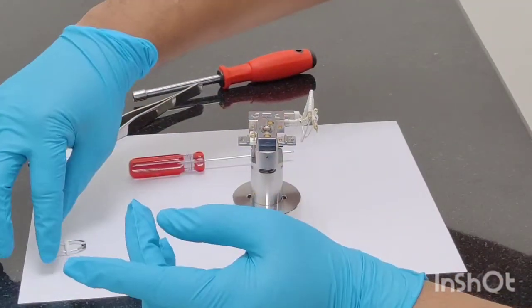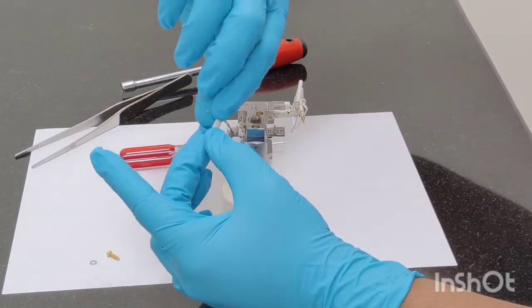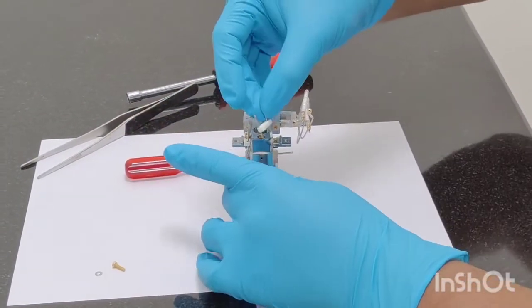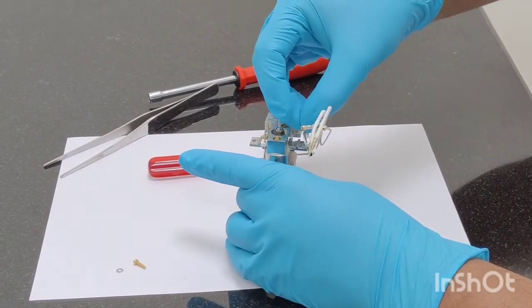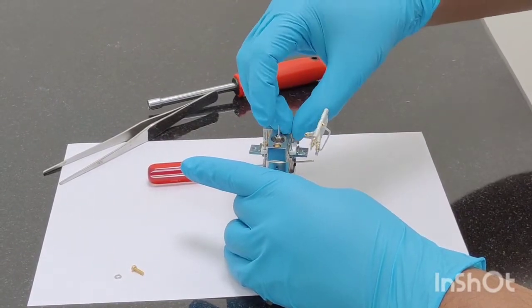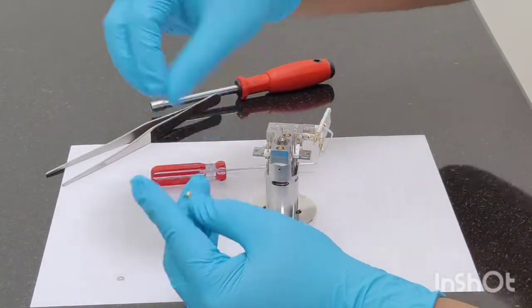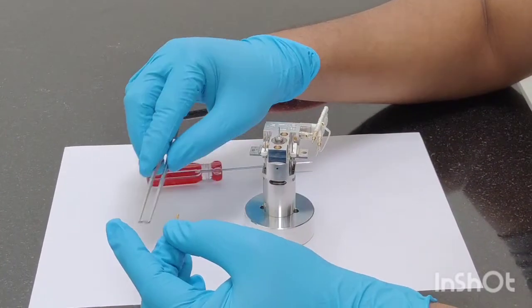Again do not over-tighten anything, all these parts are made up of ceramic. And if we over-tighten, we may end up breaking some of the parts. But no need to worry, just be careful.